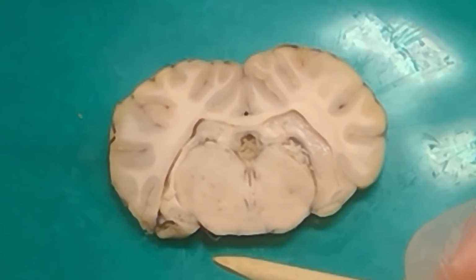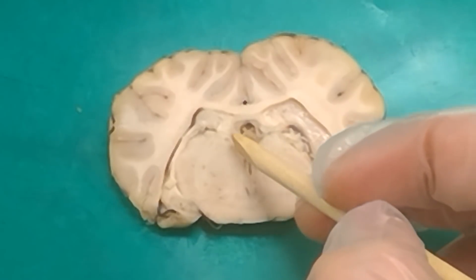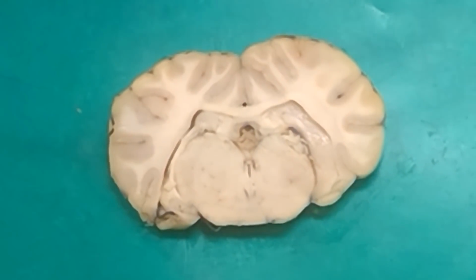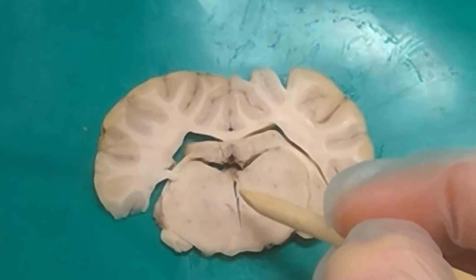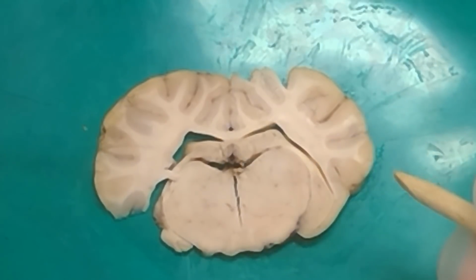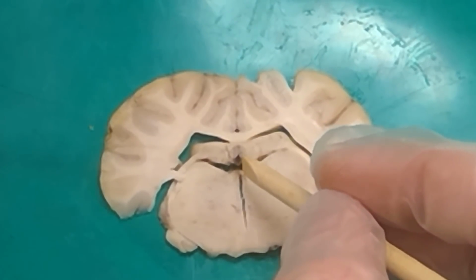Can you not see the habenula yet? You can see the habenula. It is this little bump on the inside right here. If we ask that question, it would be a bump that you can clearly see towards the inside. You can also see it on this one, which might be a little more clear. This bump right here on the inside portion, I'm going to accidentally tear it off by trying to point it out, is the habenula. So if there's a pin towards the medial portion of the thalamus, and we're asking to name the specific nucleus, that's the habenula.